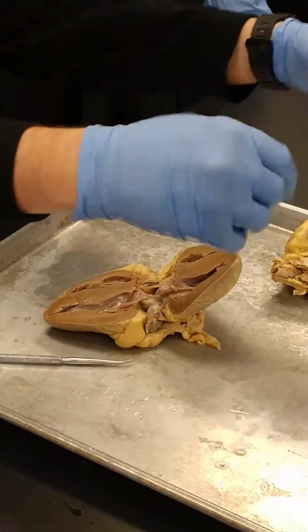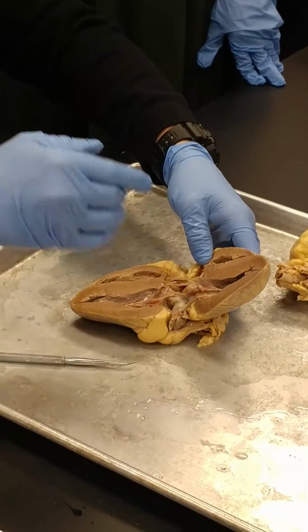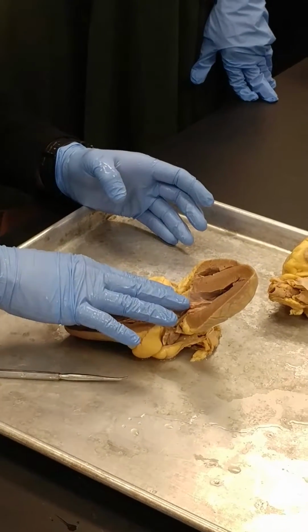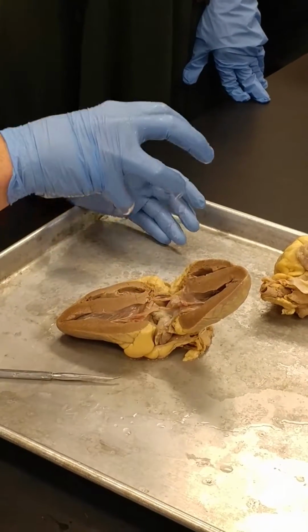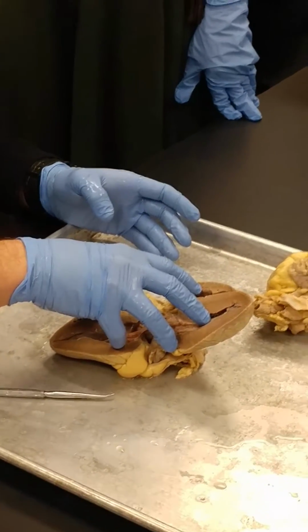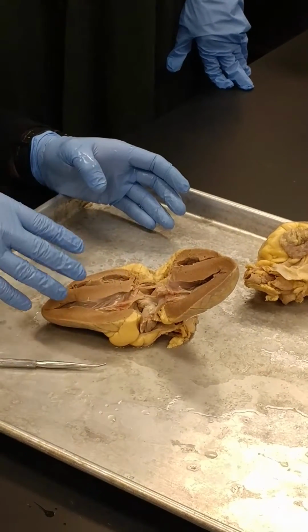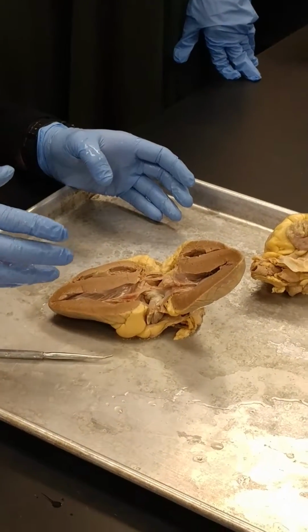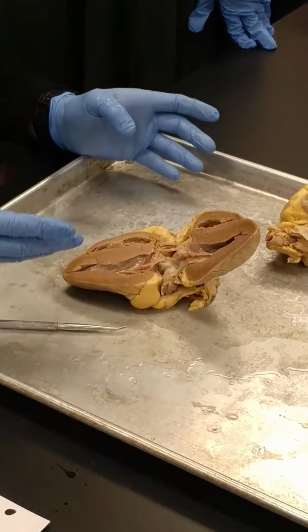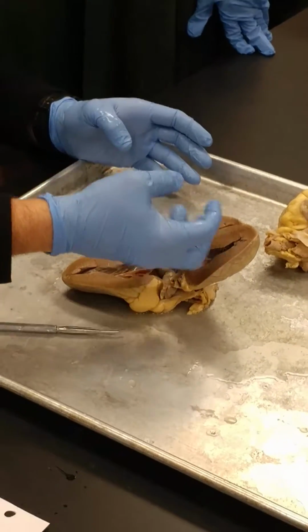Coronary sinus. So in order to find the coronary sinus, we need to go up into the right atrium again. The coronary sinus is, so here's the thing. The coronary arteries, their job is to send blood to the heart muscle tissue. Because the heart muscle tissue needs blood, doesn't it? So we're sending oxygenated blood to the heart. Does that heart then need to take the blood from the heart muscle tissue and send it somewhere after we've given off all the oxygen? Yeah, so if we send blood to the heart, we got to take blood away from the heart.